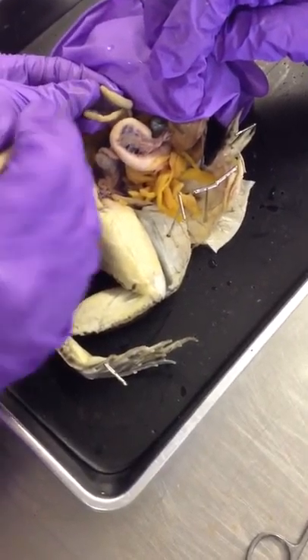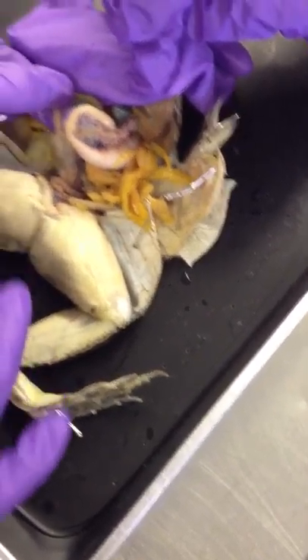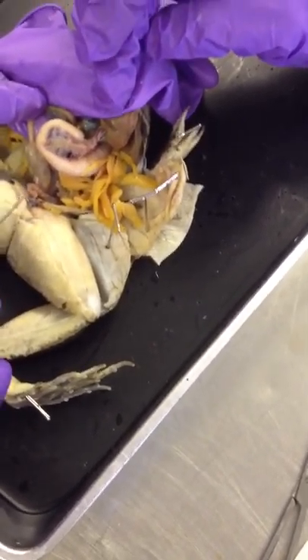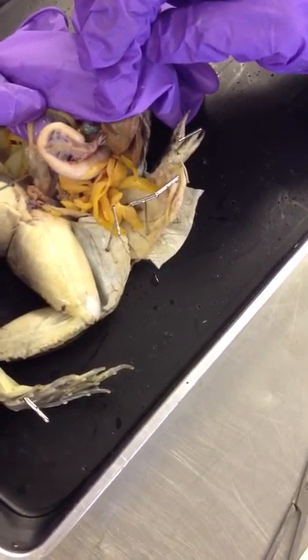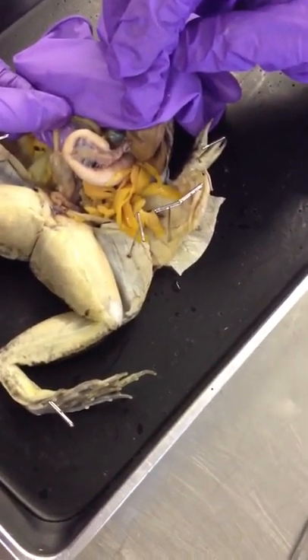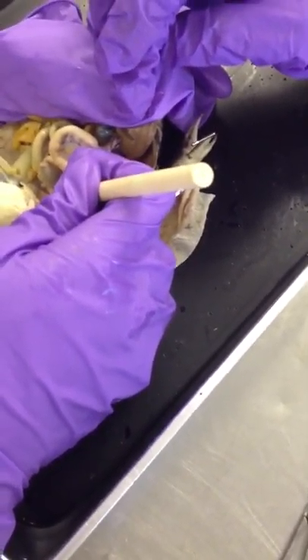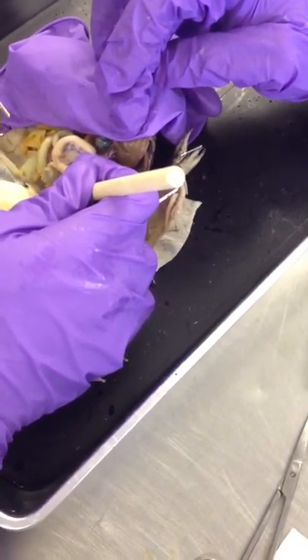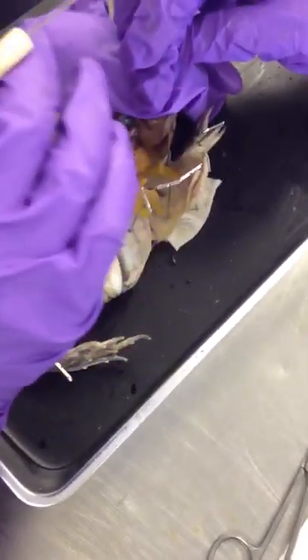The ileum ends in a straight large intestine in the frog. The digestive system in frogs is very simple — ileum goes into a straight large intestine, which goes into the anus, which then goes through the cloaca. In amphibians, just like in the lamprey, urine, feces, and gametes all pass through the cloaca. In humans that's divided differently.